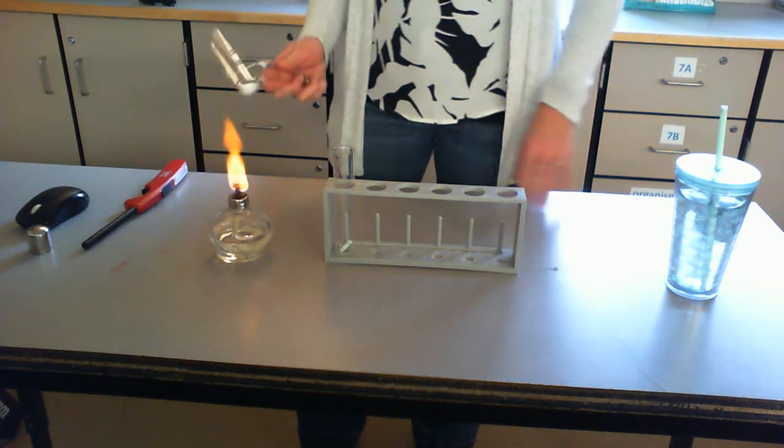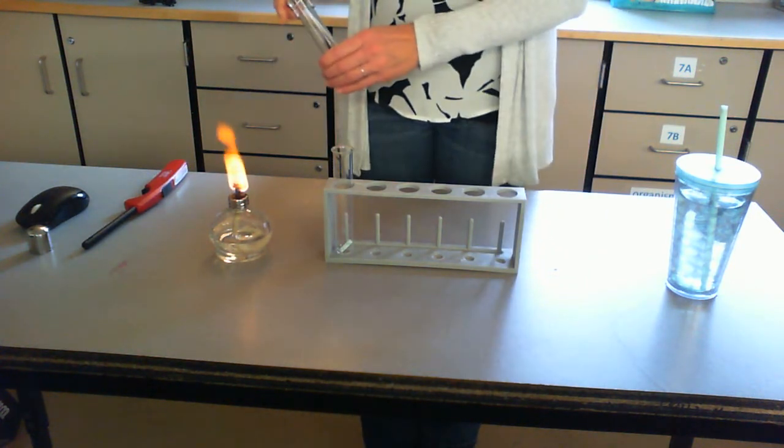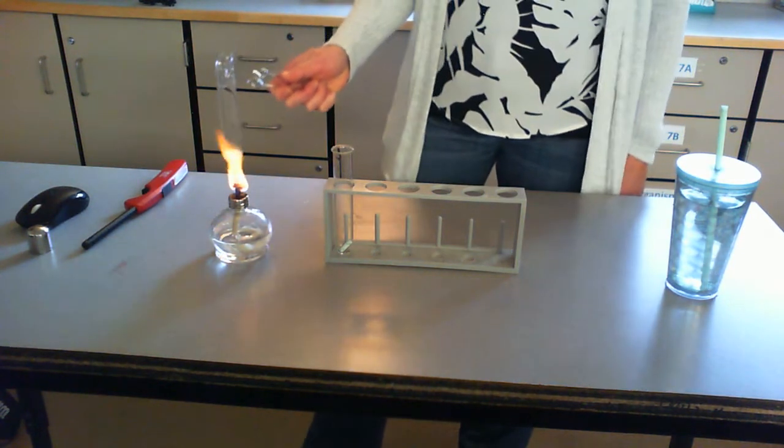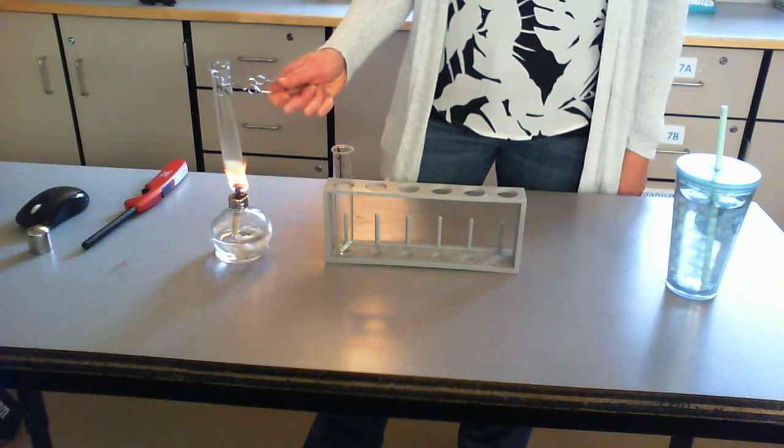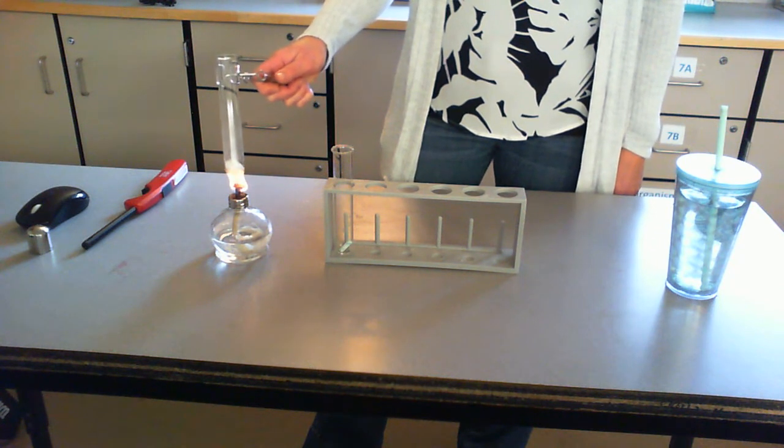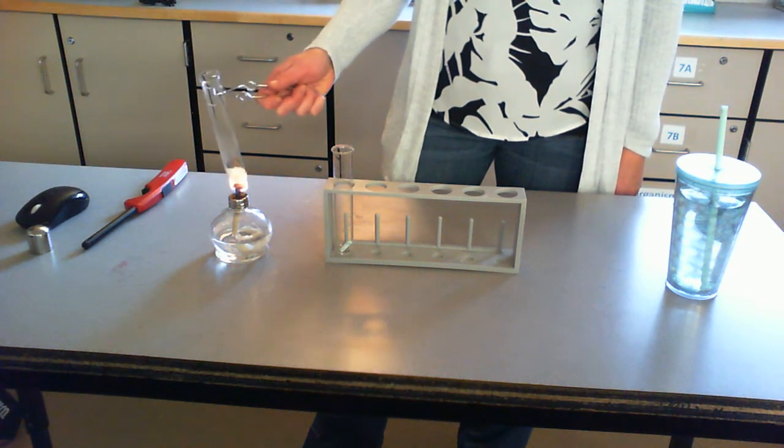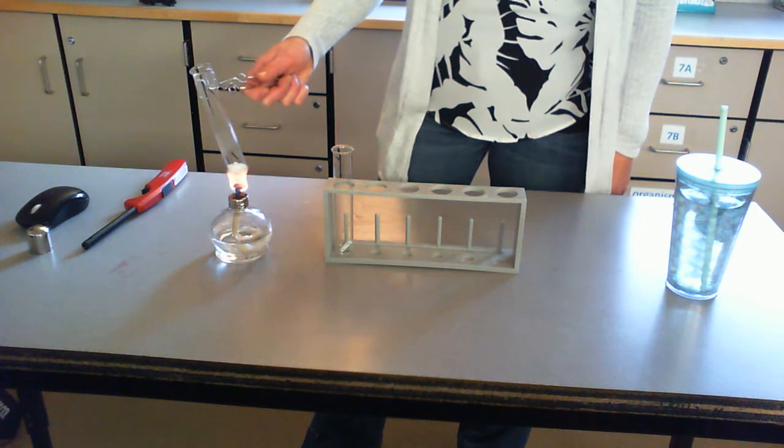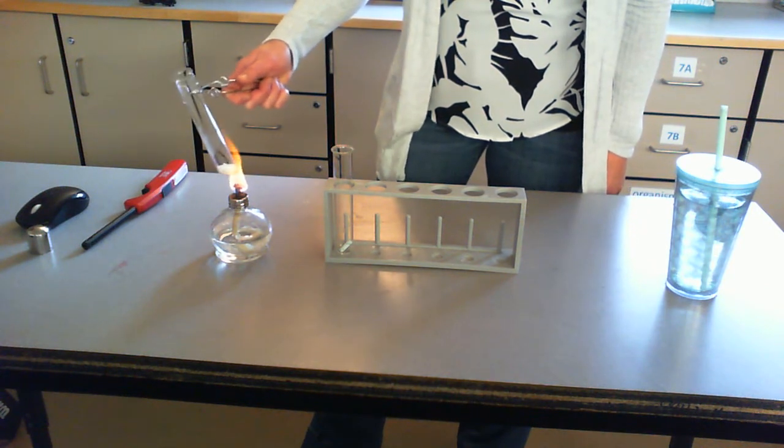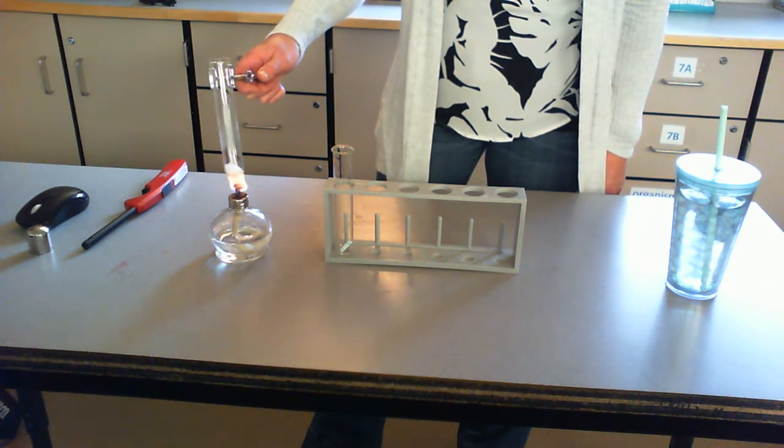So this is a test tube clamp. What's nice about these test tubes is they are pretty heat resistant and they're not going to shatter if they get too hot. So I'm going to keep heating the sugar. Not really seeing anything happening yet.